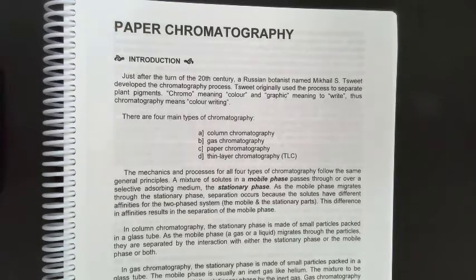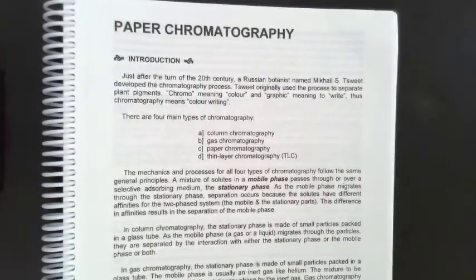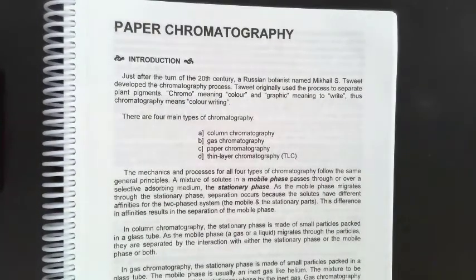So the first thing you need to understand is what is an RF value. Some people refer to RF value as a rate of flow, and so we'll just keep it at that. But again, remember, when things move through the paper, because of the density of the paper, things will move at different rates and eventually separate from each other. The same is true when you're doing gases. Because of the difference in molecular weight, they will separate on that basis.